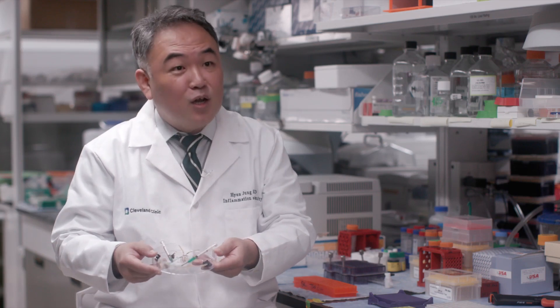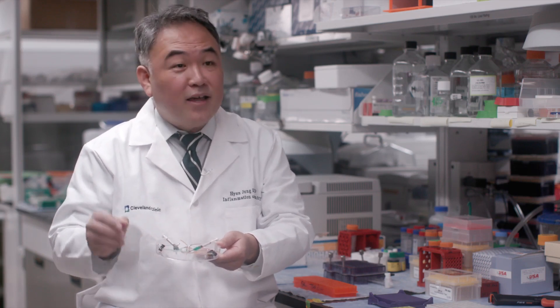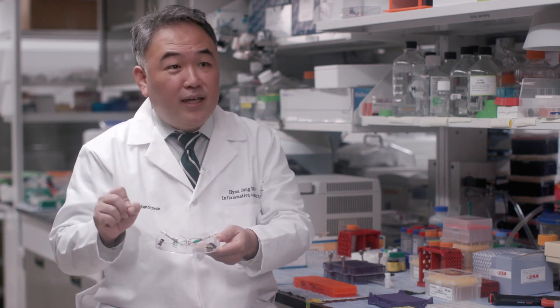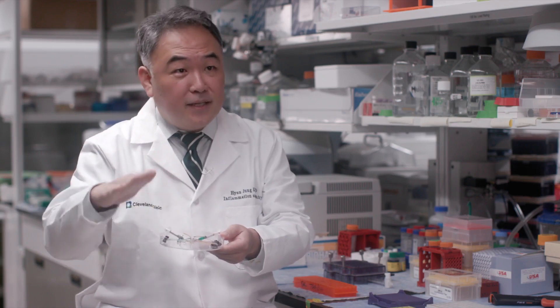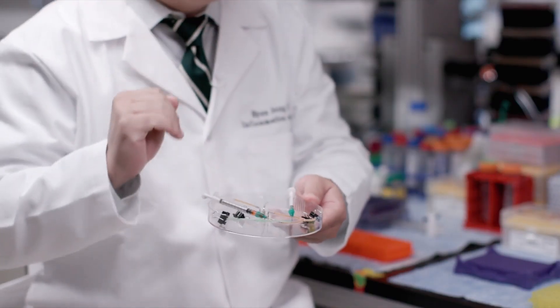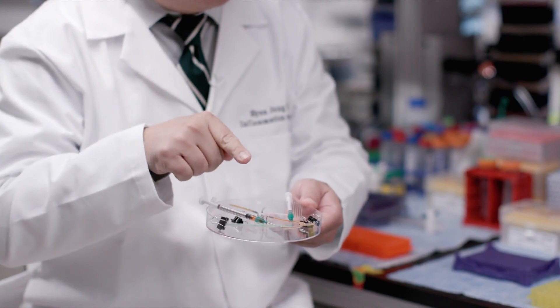This is the gut-on-a-chip we are actually working on. We are designing, fabricating, and making the chip in the lab, and then we introduce the cells into the channel.